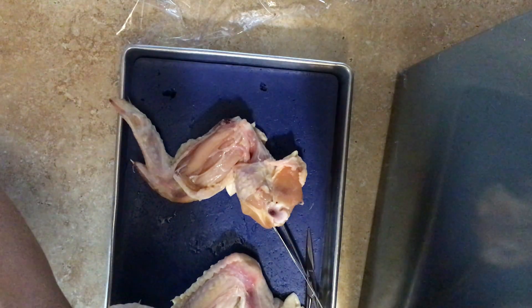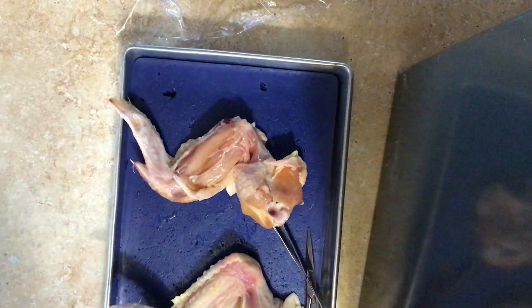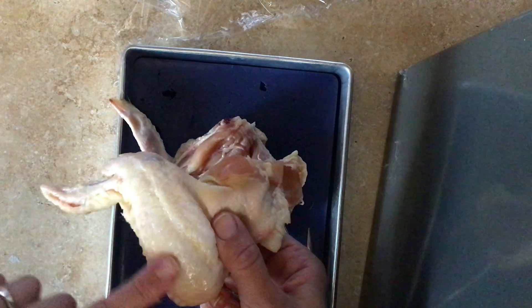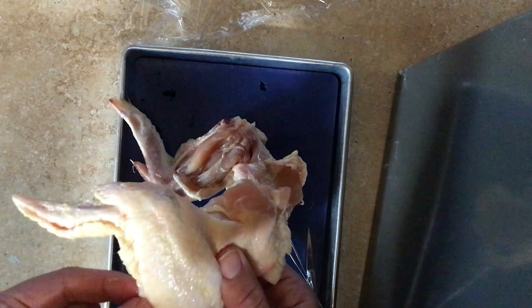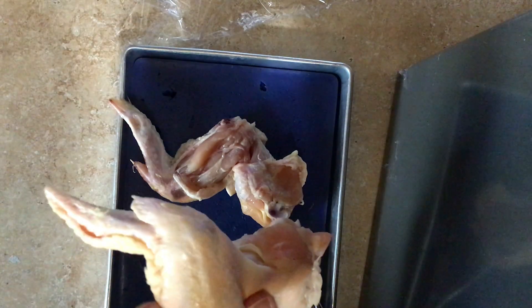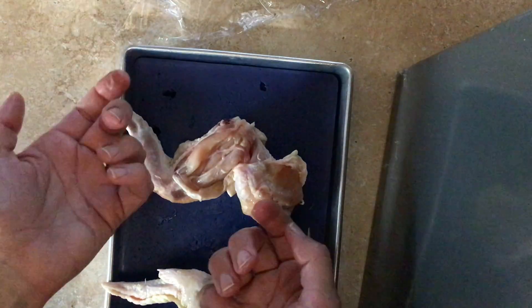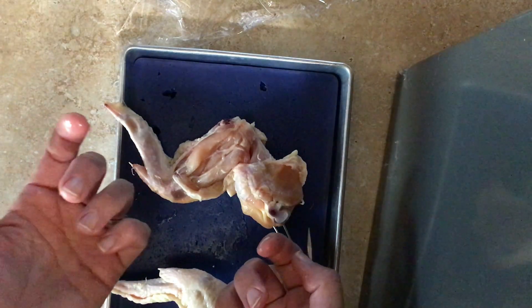Then we'll kind of be done and you should be able to fill everything in. Looking at that table — when you're looking at the skin, here's the skin, it's kind of bumpy. Some little feathers, parts of feathers still left on here and looks like hairs. Then you have the fat, which is that yellow tissue underneath there. The muscle is the pink tissue, which we had to remove the skin in order to see. Now we need to see tendons, ligaments, and cartilage.